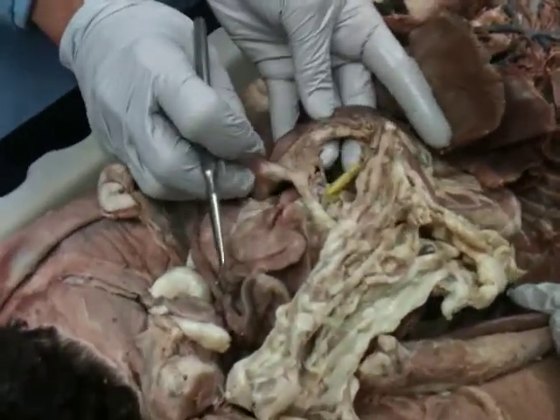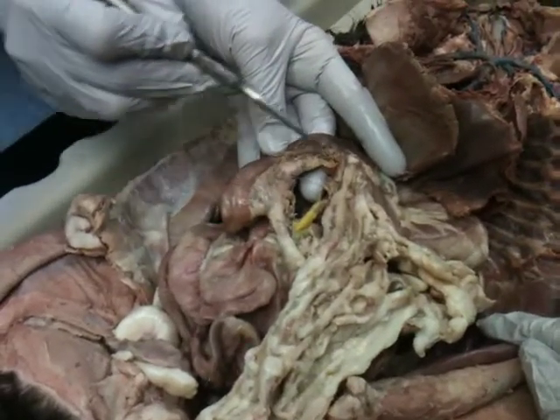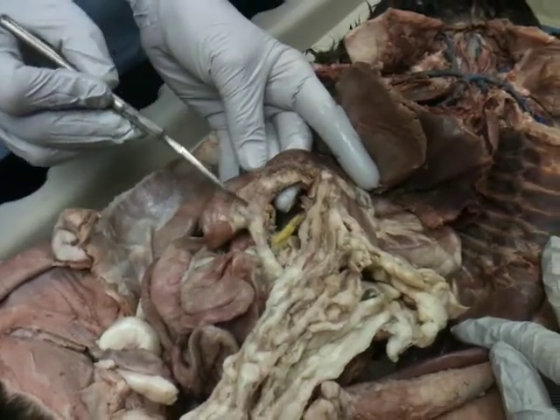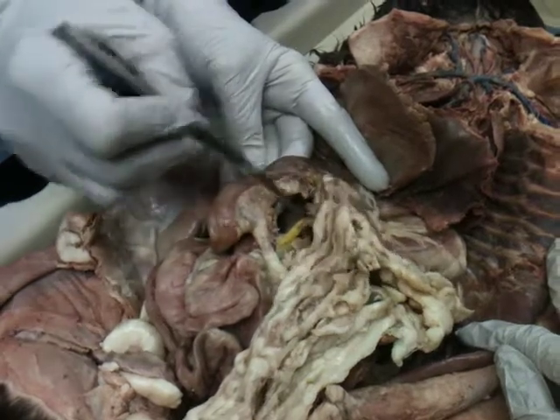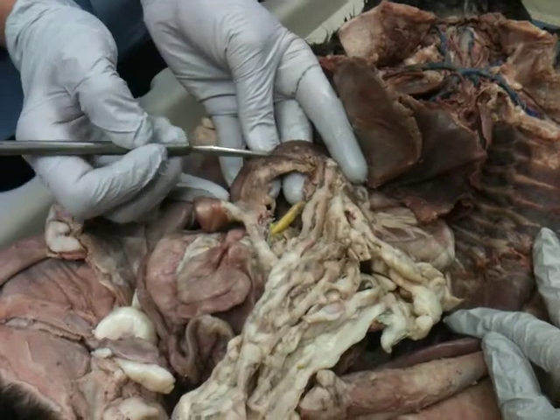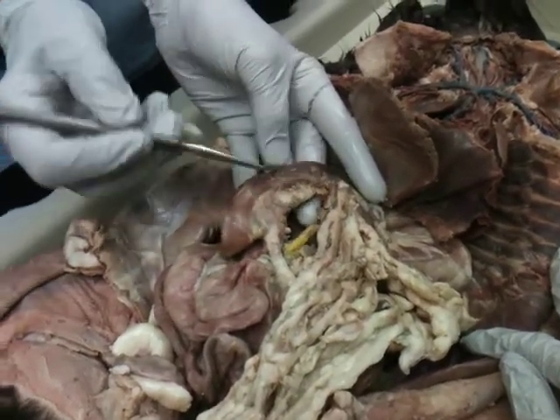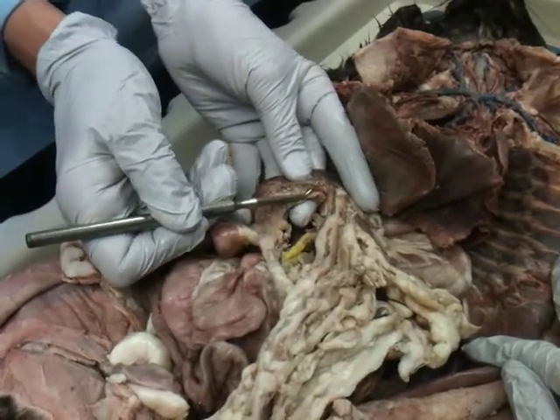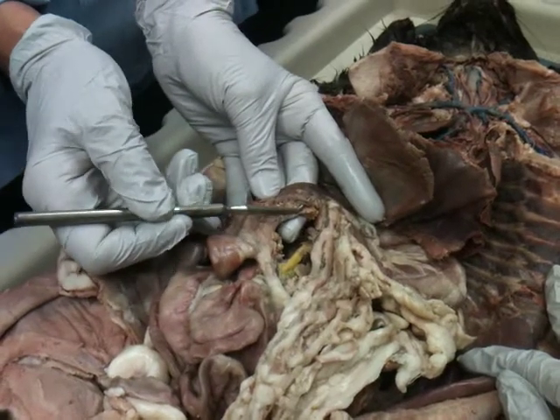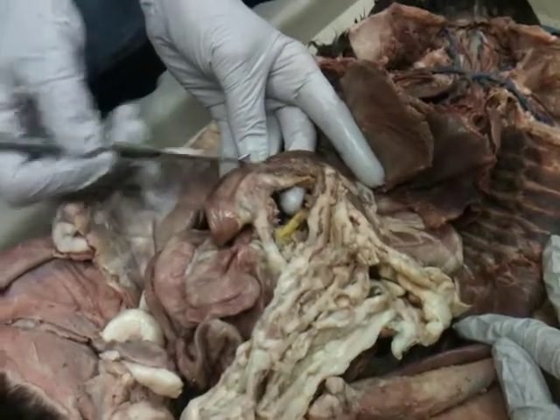Another whole separate organ is kind of held in the arms of the duodenum. What organ's this one? Pancreas. Good. It's kind of a cauliflower-like tissue that's in there. It does extend underneath the stomach a bit. Just while we're here, there are veins and arteries that go to the pancreas and the duodenum. We call those the pancreatico-duodenal artery and vein. These are the anterior pancreatico-duodenal artery and vein. Okay, we'll get to those when we go to the arteries and veins.